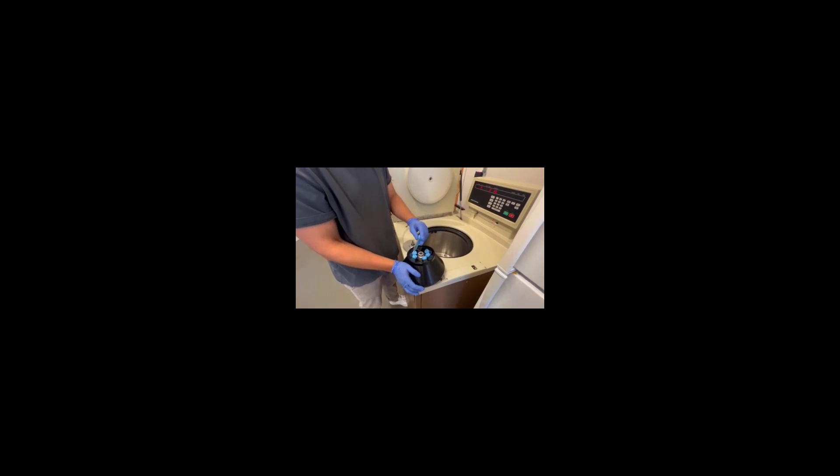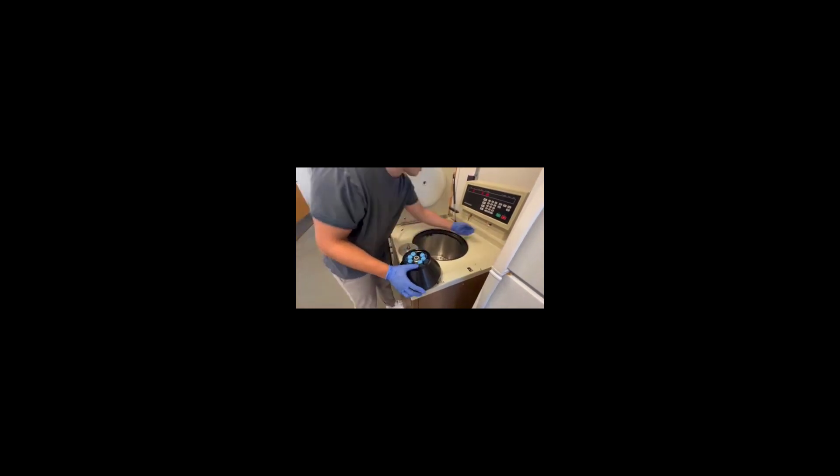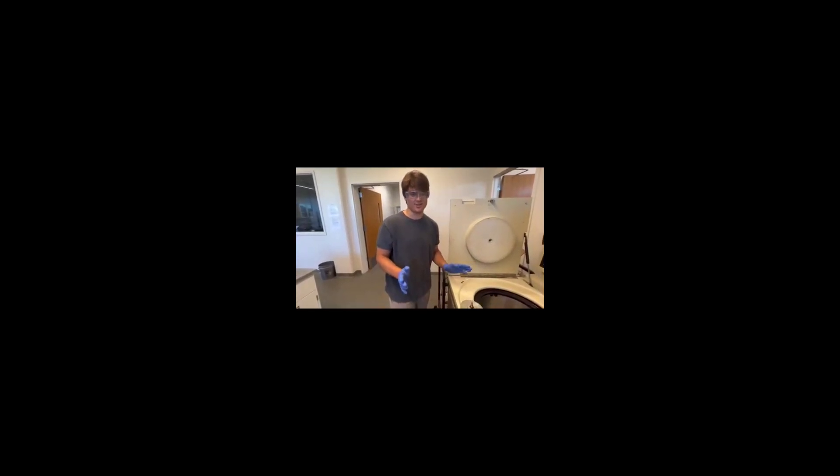Voila, after they spin around and centrifuge. And then you'll just turn it off the same way you turned it on, like so. And so that's the basics for our centrifuge in the lab.